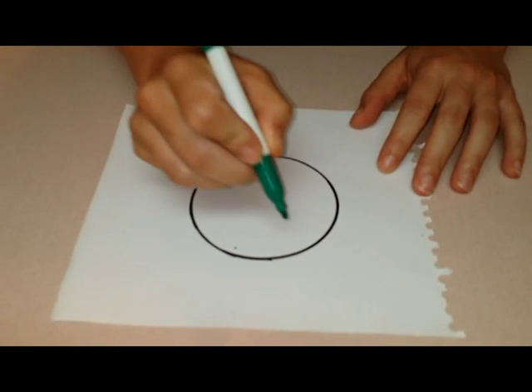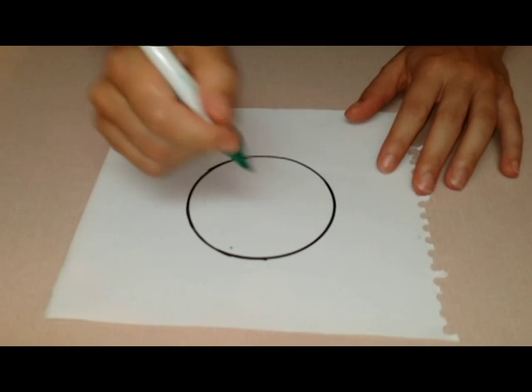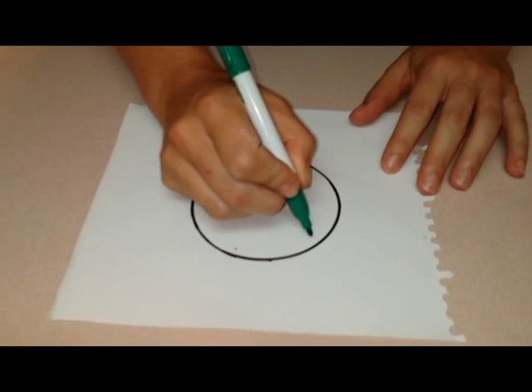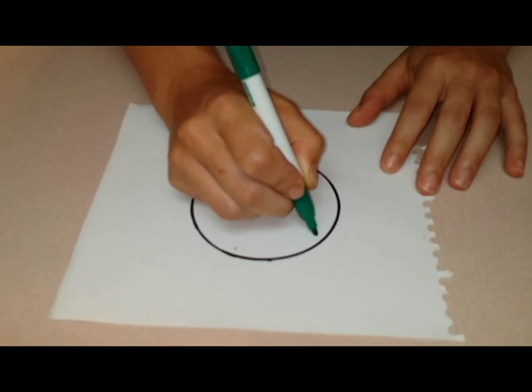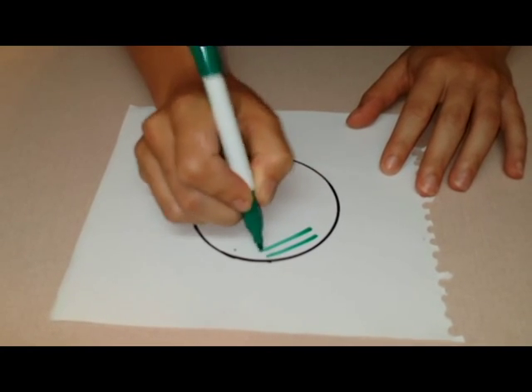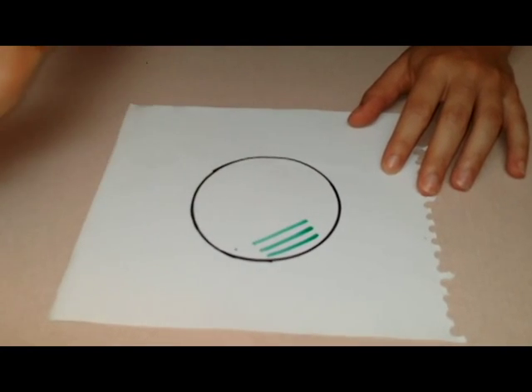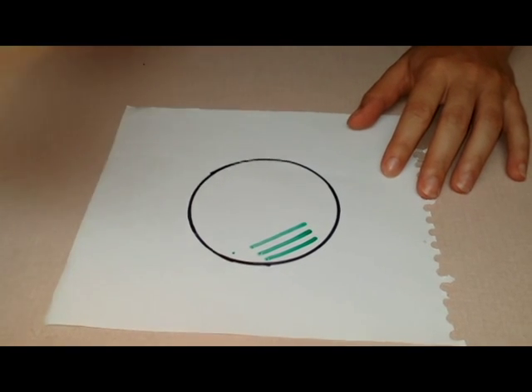Once you've touched it to your living sample either on a plate or in liquid culture, then you do three lines on the surface of the agar and you flame your loop again.